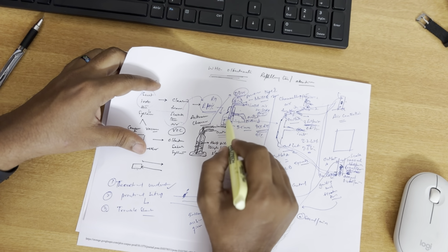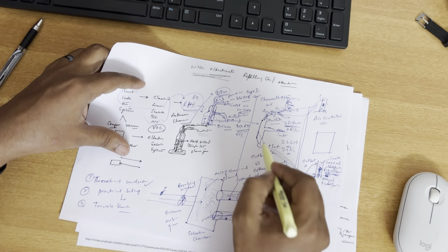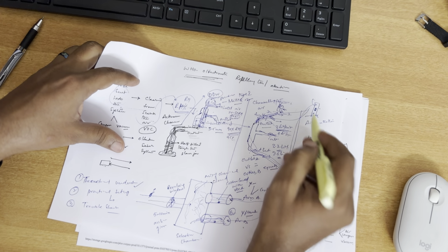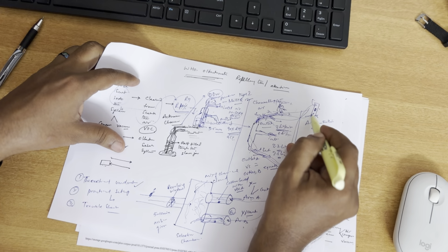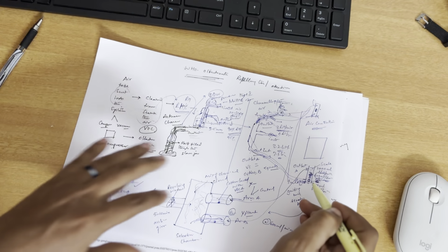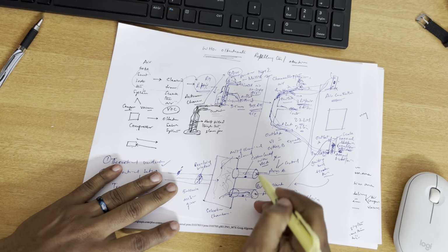So once the air is humidified here, you divide the air into two ways, outlet A and outlet B. That is regulated here using the air controllers, so that once you send the air to the regulators, you can see visually and manipulate what amount of air you want to let into the system. The controlled air is then channeled into chamber A and chamber B.